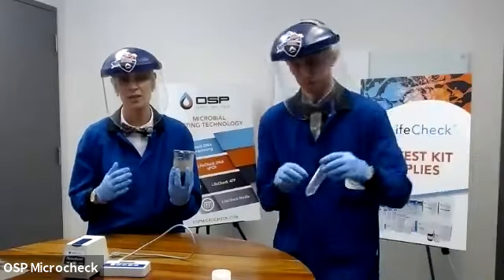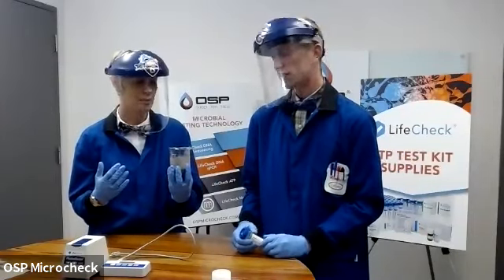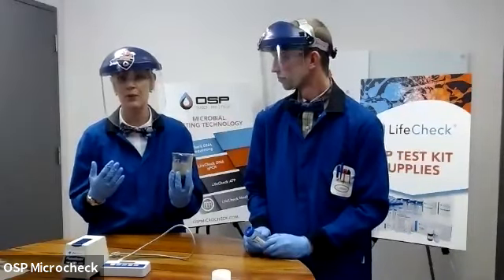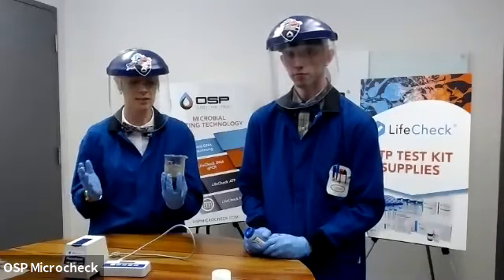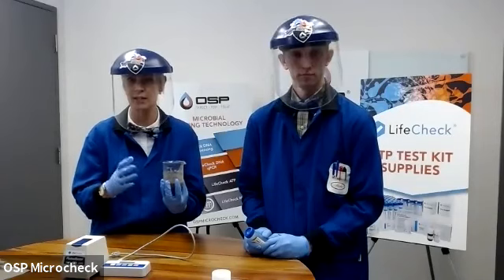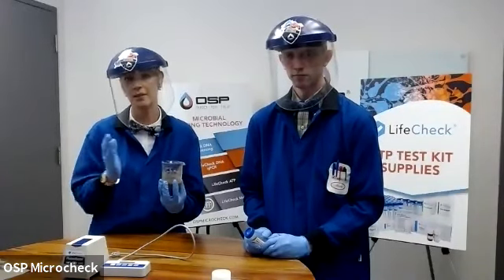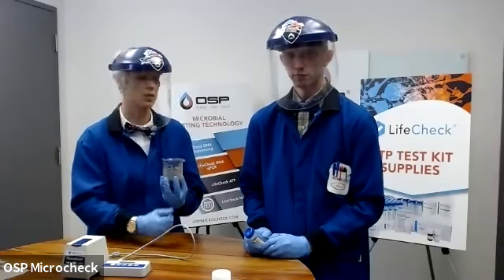So you saw me struggle with that first sample, but we still got through 20 mils. Yeah, and that was enough. Yeah, and if you can get through some, again, just make sure you're using these consistent procedures. If you're going to use the filter procedure for one of your tests in a group of testing or ones that you're comparing, stick with it. Otherwise, switch and do them all with the other procedure.